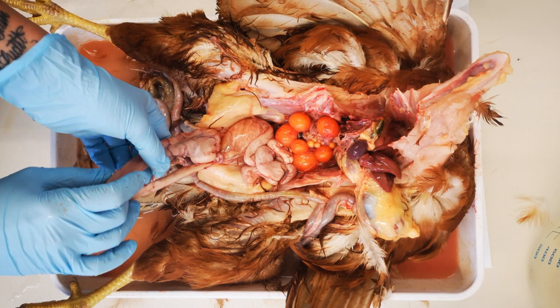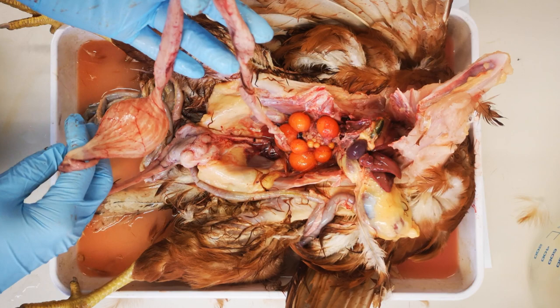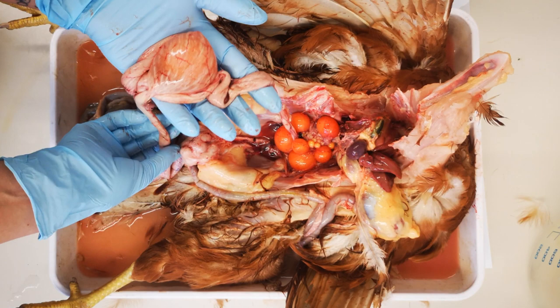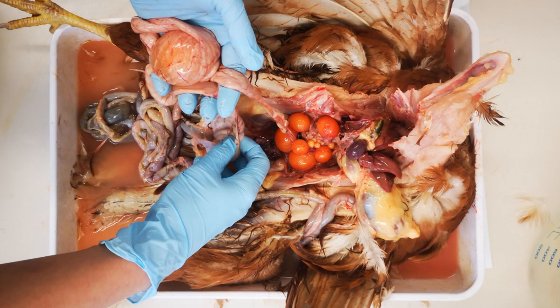Once the digestive tract has been removed and laid out, the genital organs of the preparation object can be identified. In the female bird, the hen, the oviduct becomes visible. In birds, the oviduct is the section of the female sexual organs in which the finished egg is produced around the yolk sphere and transported to the outside by the cloaca. In the domestic chicken, it takes around 24 hours for an egg to pass along the oviduct, 20 hours of which consists of shell formation.